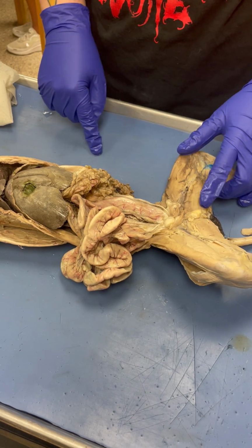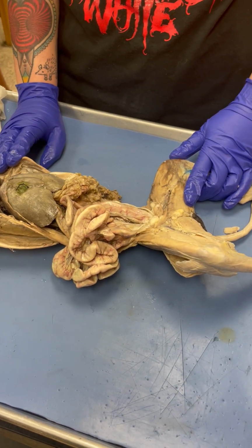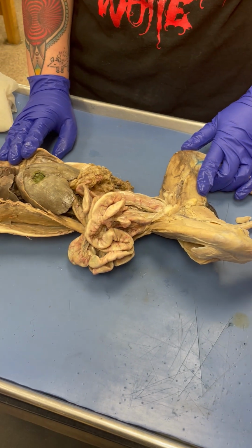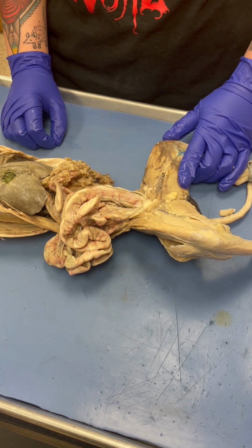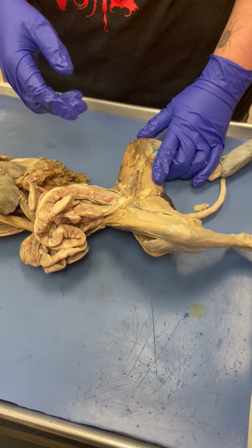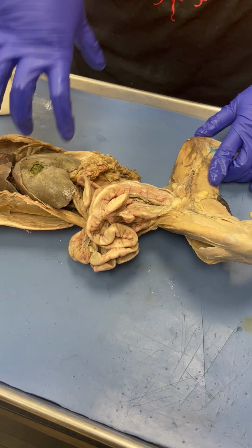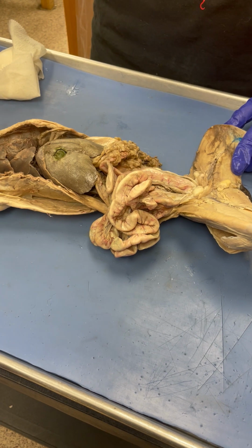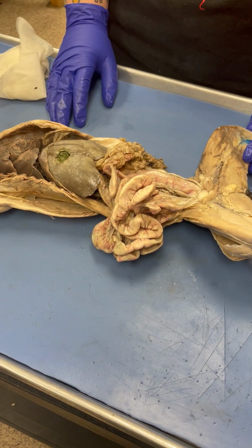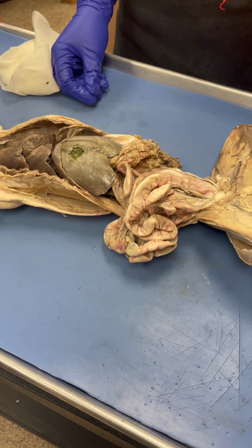That's the rectum. So on the questions with the cat, there'll be a pin sticking out here, and you identify that part. Are you going to ask questions about it, like what does this do? Yeah, I could. I'm going to have fewer of those questions. I'm less likely to ask those on the cat and more likely on the models. Gotcha. Just because on the cat stations, there are only 2 cats, so there'll probably be 5 pins in both cats.